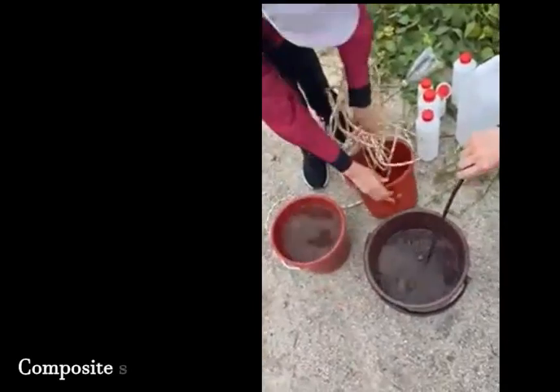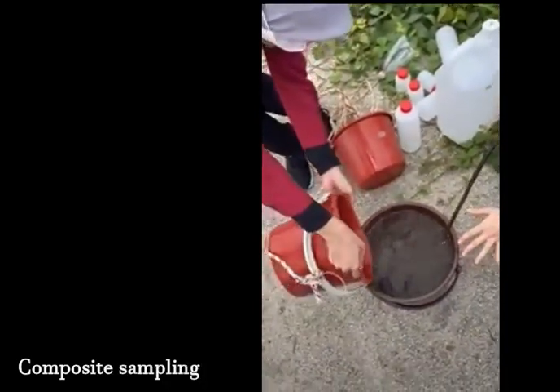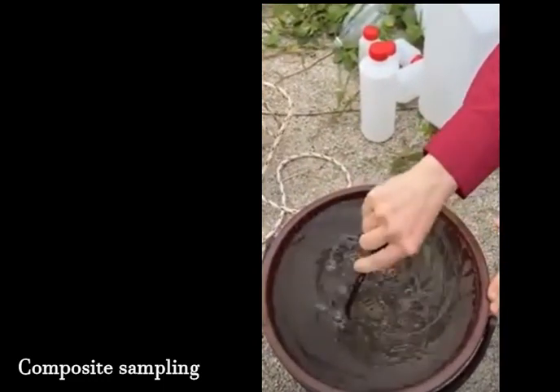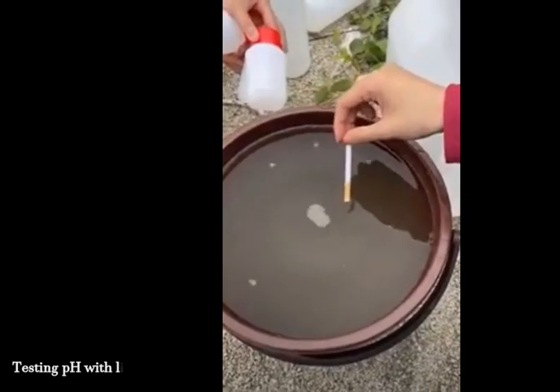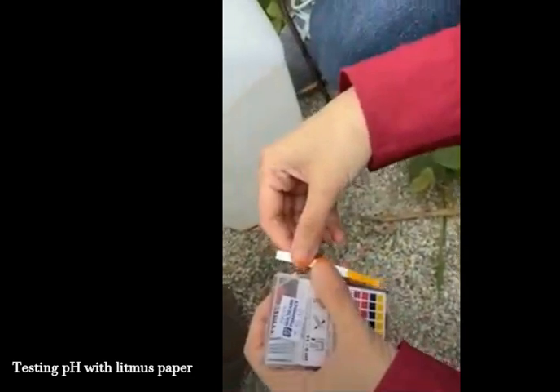Besides, composite sampling was adopted by taking water samples from 6 different points and pouring them together into one. The pH of the water sample was tested immediately before it was transferred into the bottle.